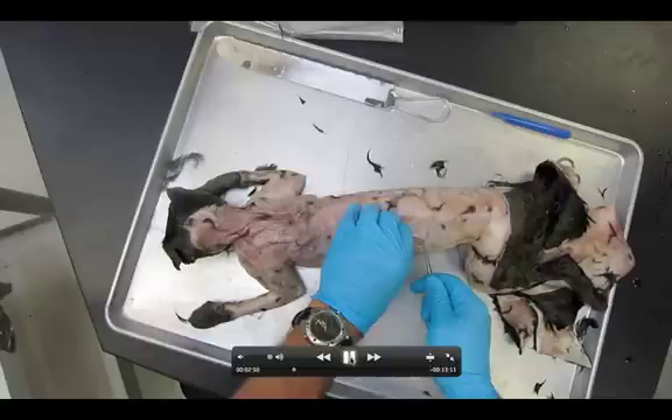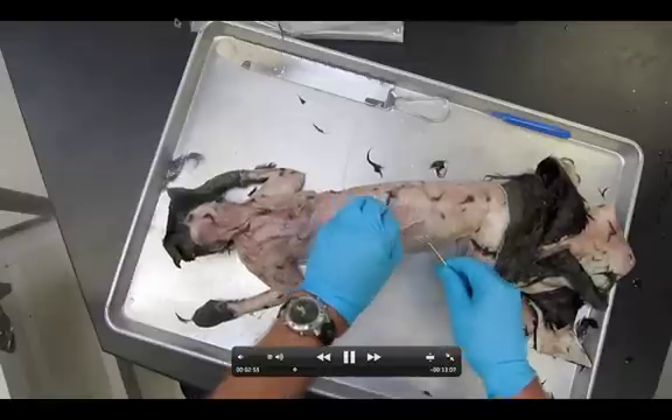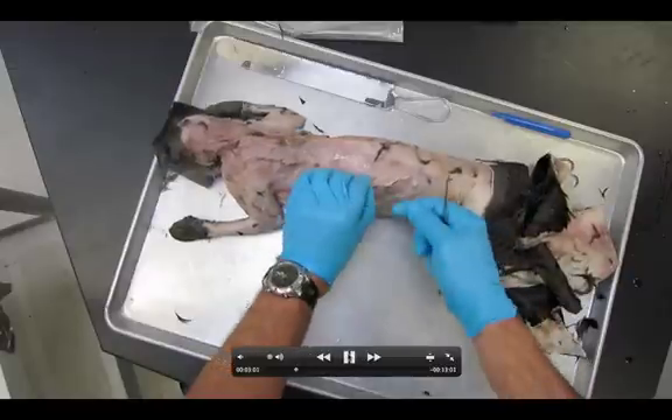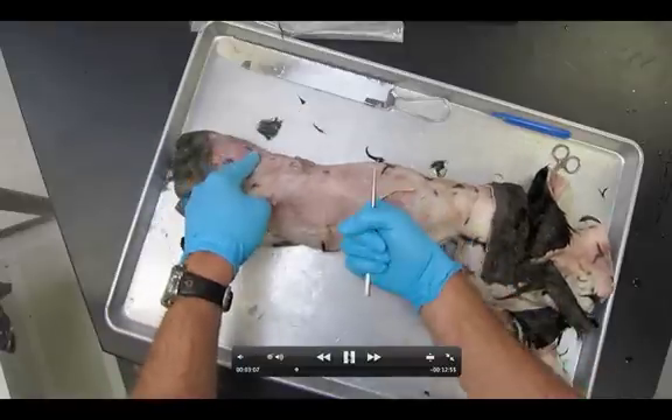You have a nice view of it right here of what I'm trying to show you. If I pause it, you can see right here — I do not want to go on this line here at all. You can see there's a line right there. Do not shove your probe in here. We're going up this direction only with our probe. Really important. I'm going to free things up with my finger. You can see how deep I'm actually able to get underneath the latissimus dorsi.